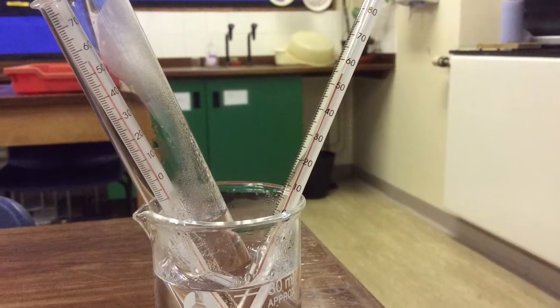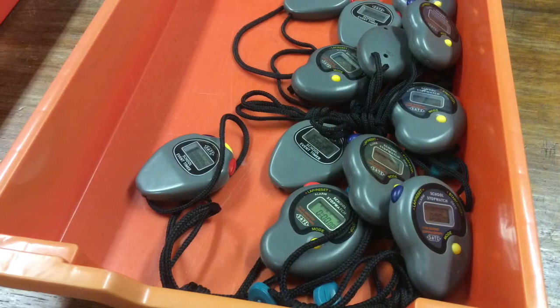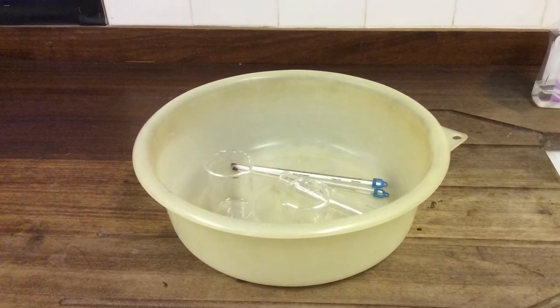Take at least 10 results in this experiment because you're going to draw a graph. Return the stopwatches to the tray and return the glassware to the washing up bowl at the back of the room.